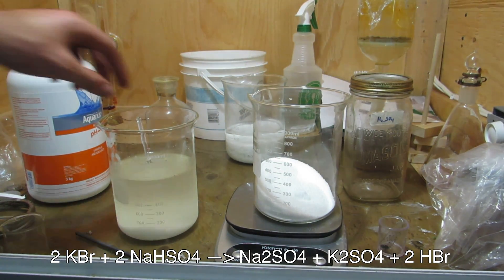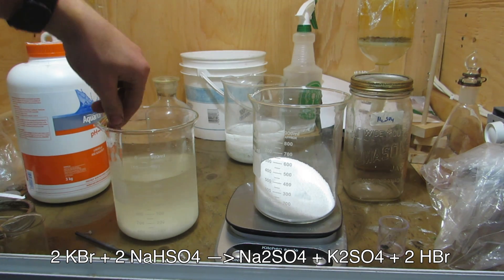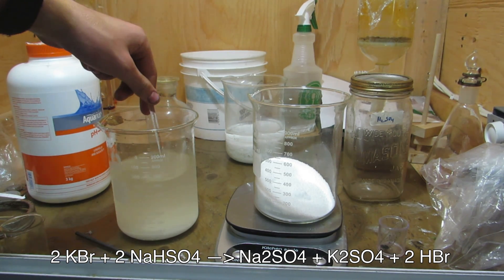Alternatively, sulfuric acid could be used from sulfuric acid-based drain cleaners, but the addition must be done dropwise with an addition funnel as it is very exothermic.